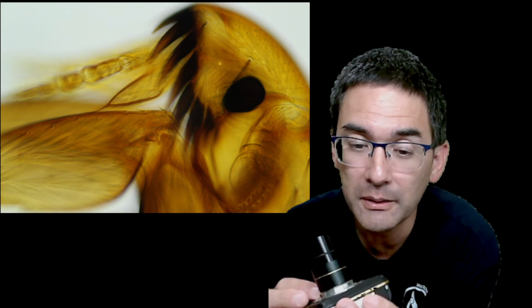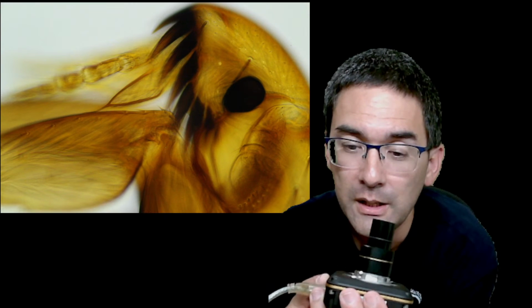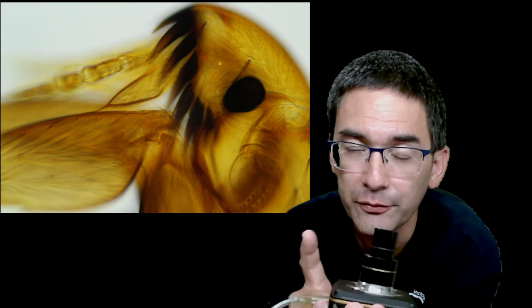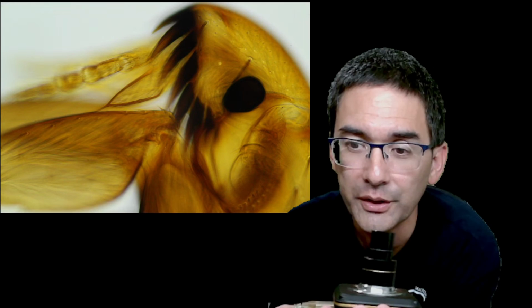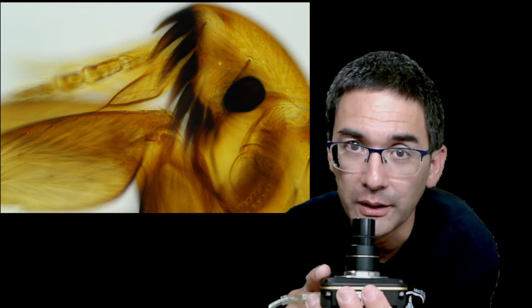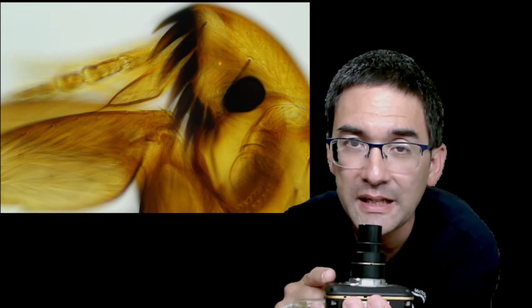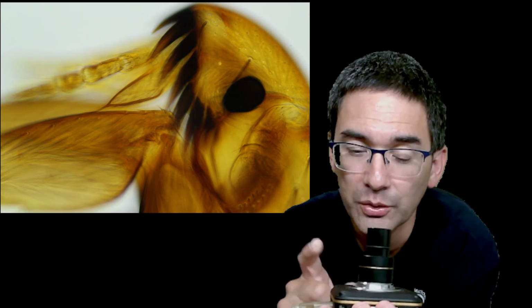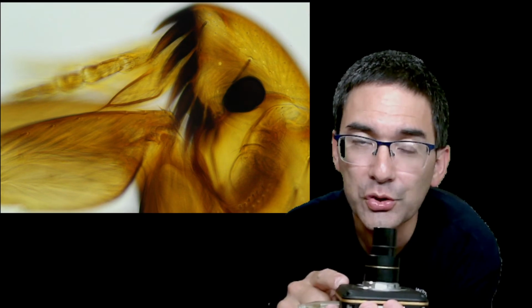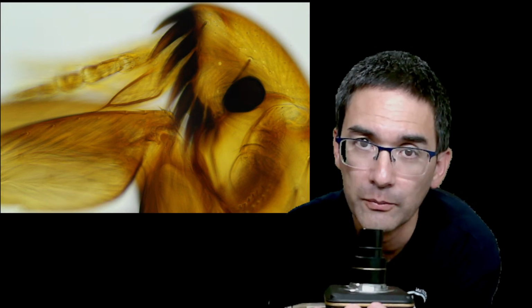They look like this, but you can put an SD card into them. This means that you do not have to go over USB to record it, but you can record it directly in the camera. So this solves many of the problems, and some of them also have an HDMI connection, so that you can directly connect this to a monitor without the need of a computer. So that's also quite an advantage.